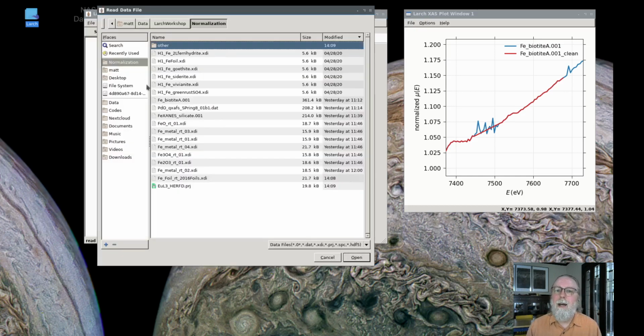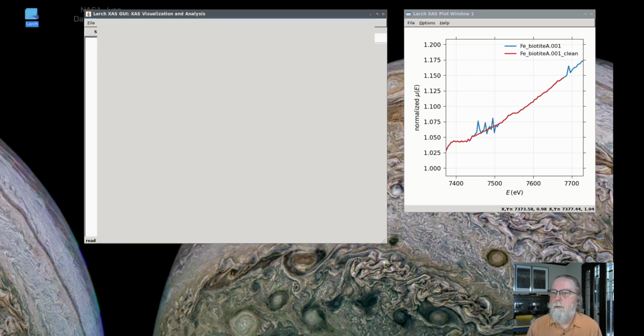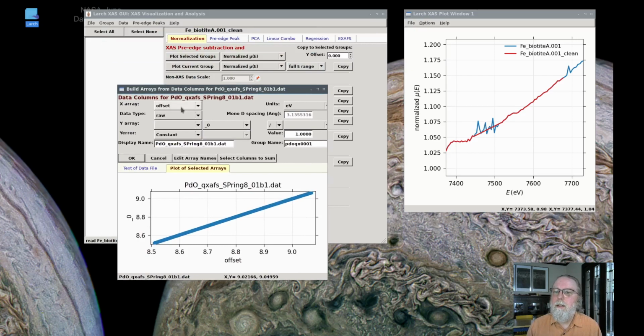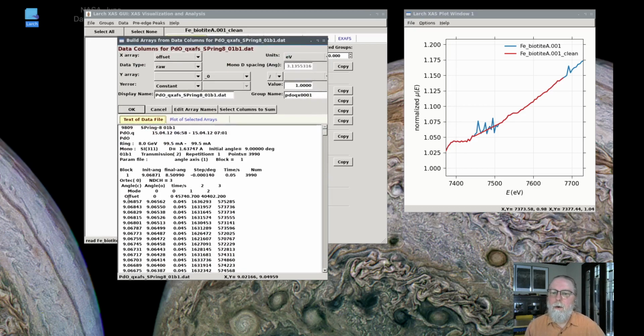So to do that, I'm going to show a few different things with this one data set. Palladium oxide collected in quick XAFS mode at constant angular rate from a SPring-8 beamline. So here when I read this data set in, actually this data was collected in angle. If I go here and show this, it didn't collect the energy in eV, but it collected in angle, and so we'll want to convert that to energy.